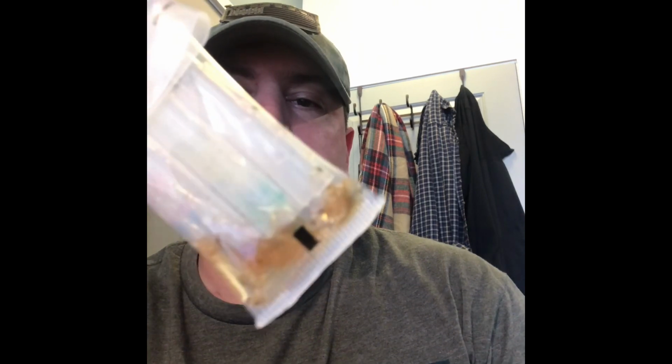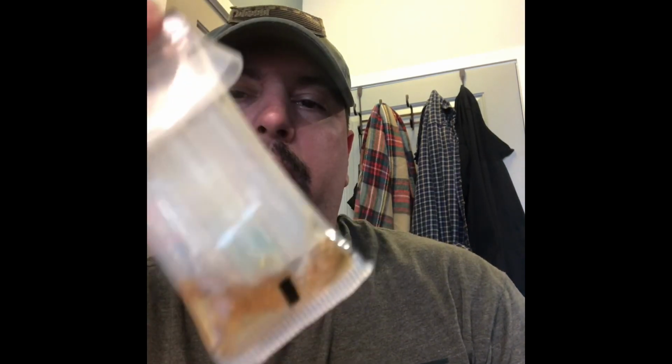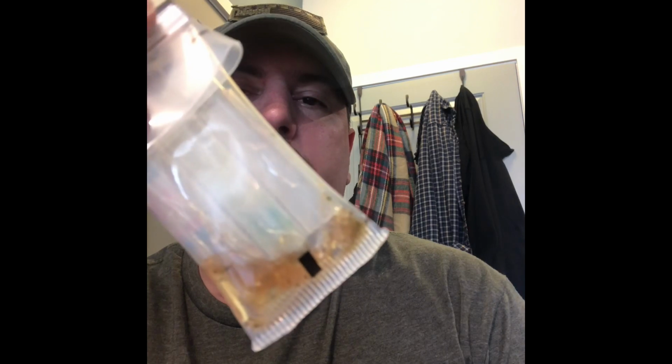Just a random substance thrown in there, just like they did. I'm not a scientist, they are, so kind of weird. But I wouldn't have a substance that wasn't cocaine and put it in here and test. It'd have to be a white powdery substance or something that looks like crack. They're putting random stuff in, I can do the same.